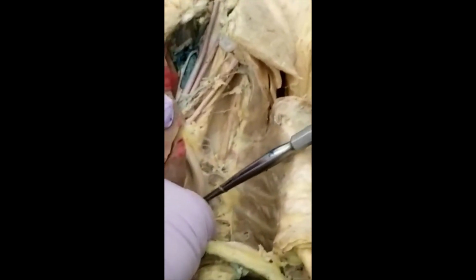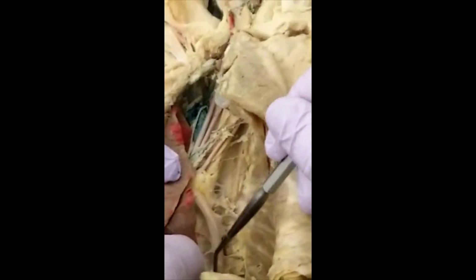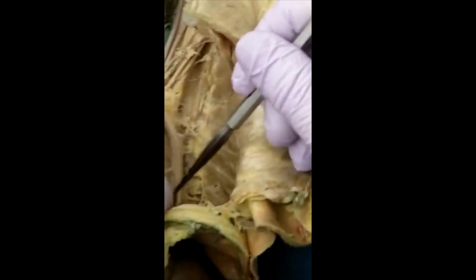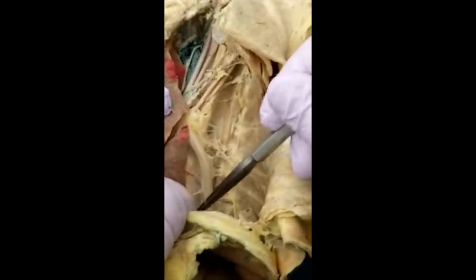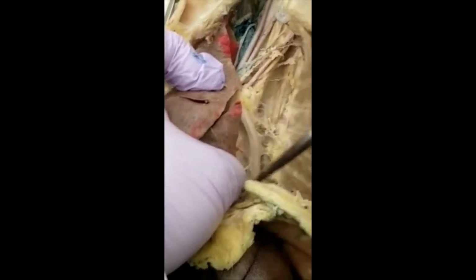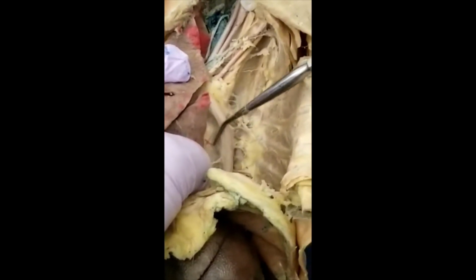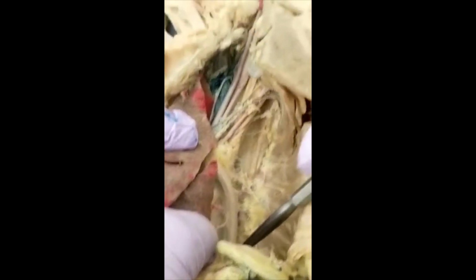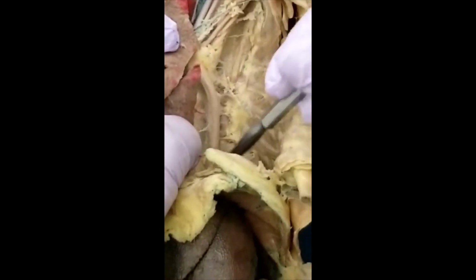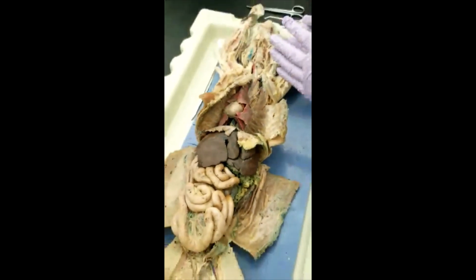And the one going medial, you also have to break more of this membrane. So you see these tiny blood vessels, one here. Those are esophageal. So you get several esophageals over here. This is one, this is one, this is one over here, and if you're going down, you see more. So those are esophageals. All right. So that's all the arteries above the diaphragm.